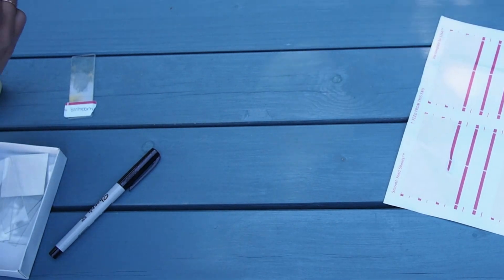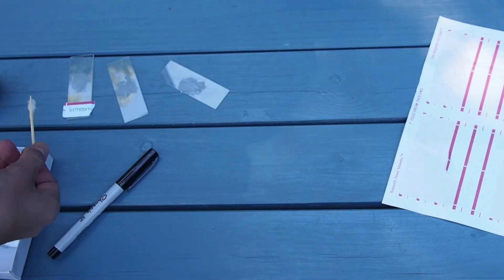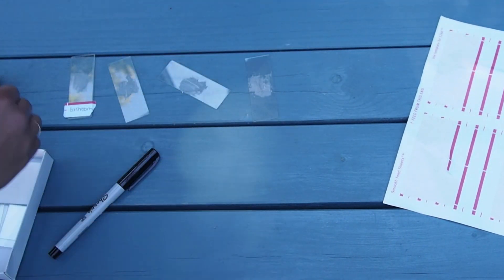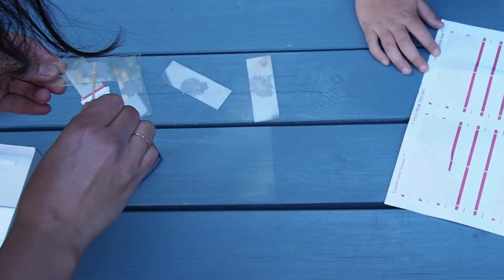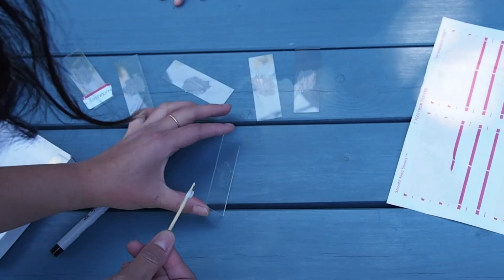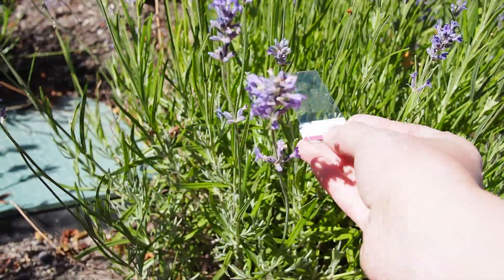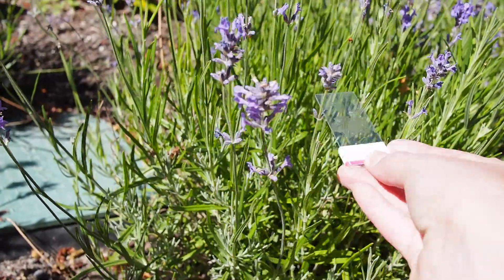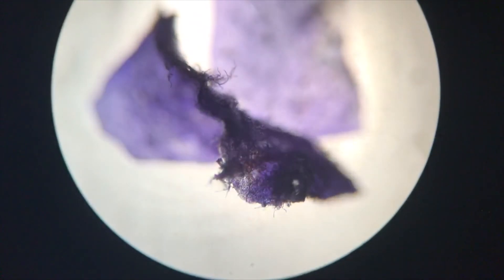We made a number of different slides so that we could take them around our house and our backyard searching for samples. First we decided to sample some lavender growing in our backyard. Here you can see the lavender slides under the microscope.